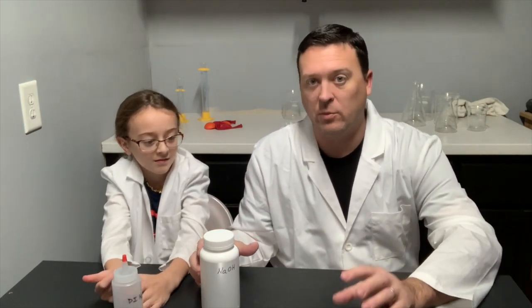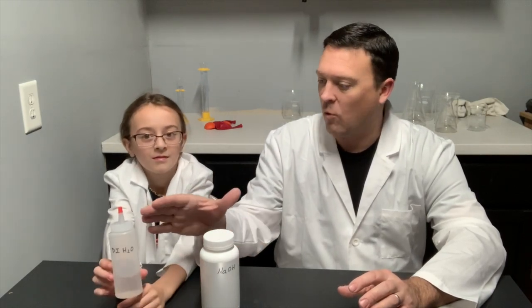Alright, so in order to do this experiment, we're actually going to use some aluminum foil, some sodium hydroxide, and some water.